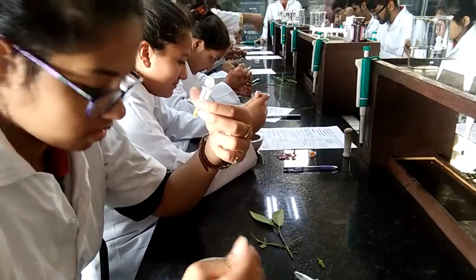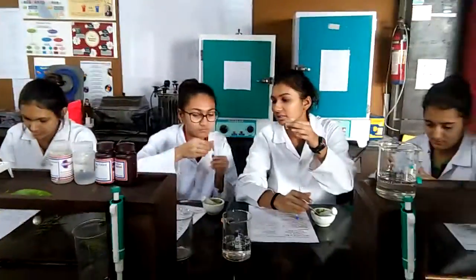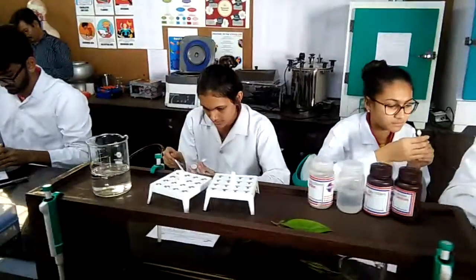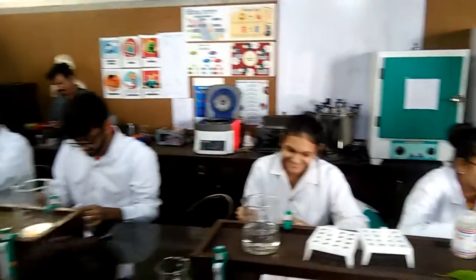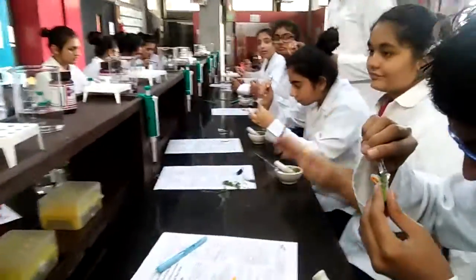This is telling us that we have a lesser amount. Okay, I know it is 2 ml added buffer. Fill it — one tube only you have to fill.